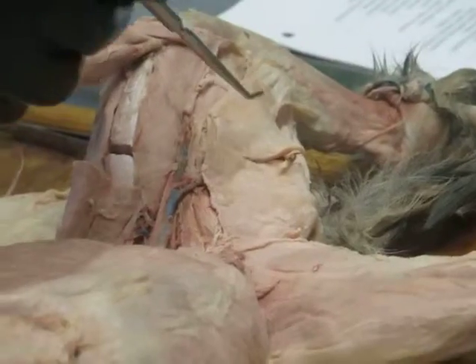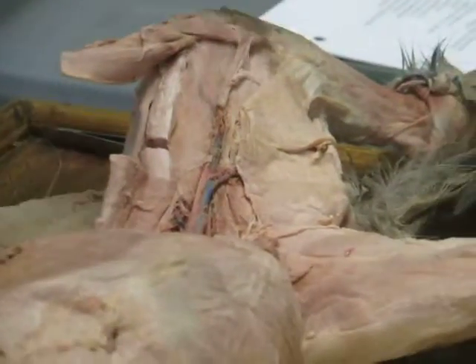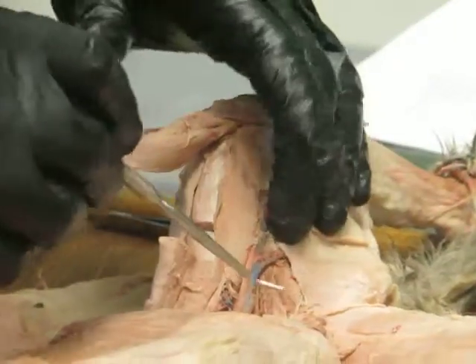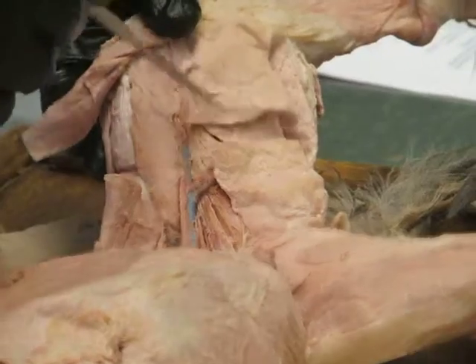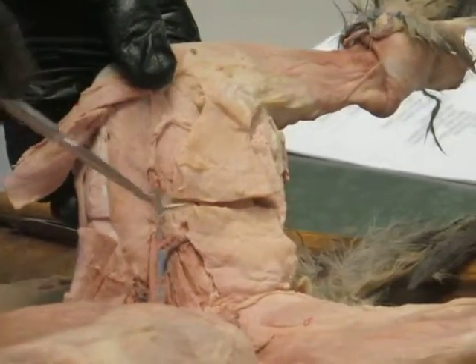Okay. Let's look here again, medially, and there we go. Match things up. Notice how when I transect muscles, I try to cut them right across the middle of their belly in such a way that I can match up the two cut ends. And that's generally the best idea, rather than cutting them off their origin or insertion and wondering where they used to attach. So on the medial side of the thigh, this is kind of the most obvious thing you meet with right off, this guy here. This would be the gracilis.